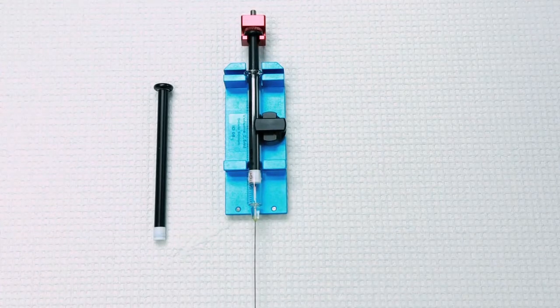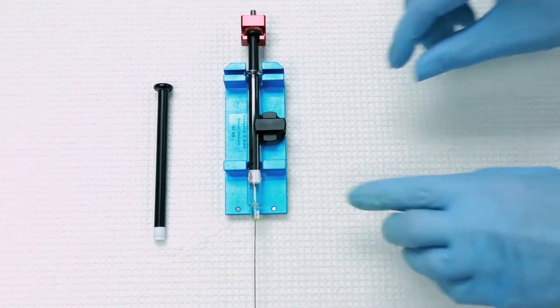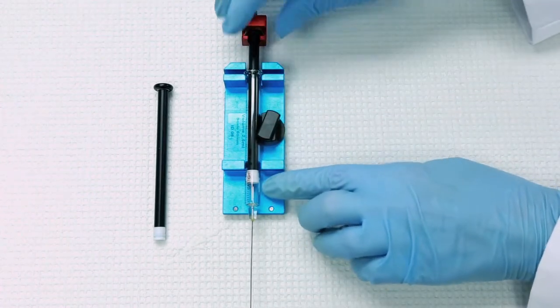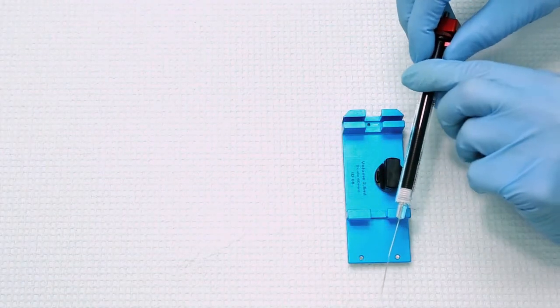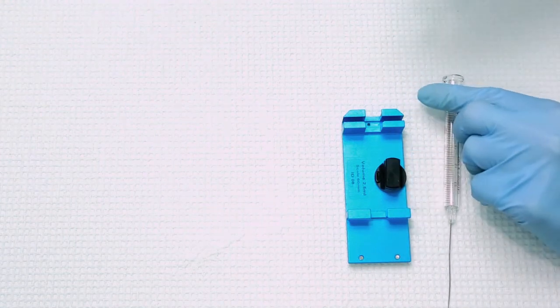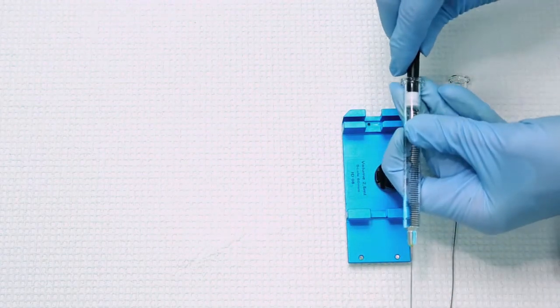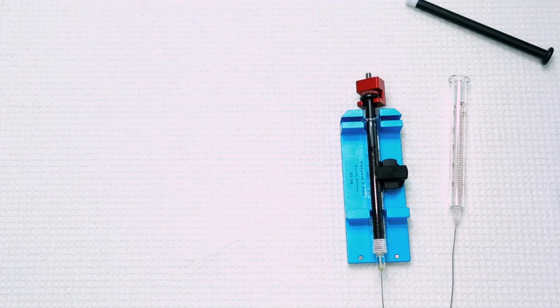After you remove the syringe assembly from the auto sampler, lie the system down on a flat surface, move the holder and remove the syringe. If you are replacing the syringe part only, remove the piston and replace it with a new syringe. Reinsert into the holder and you're all set to reinsert into the auto sampler.